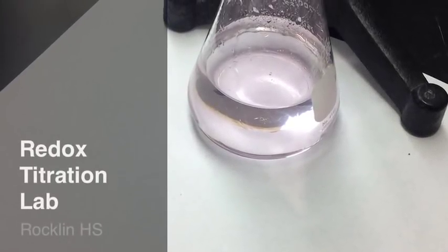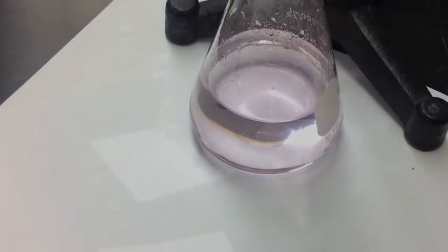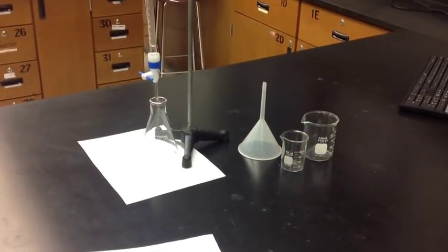This is the redox titration lab video that will accompany the lab and you need to complete the quiz at the end of this.